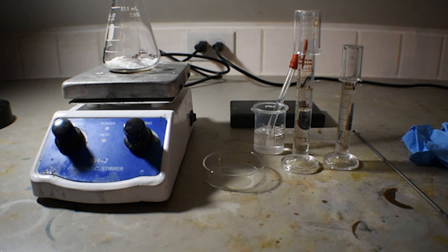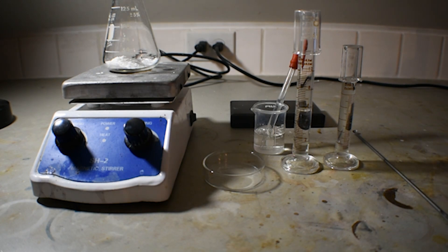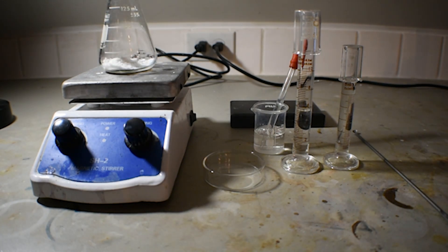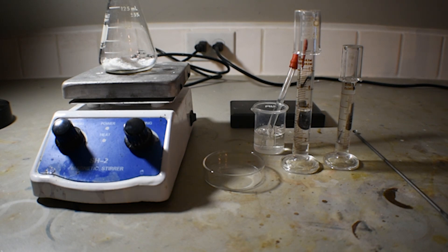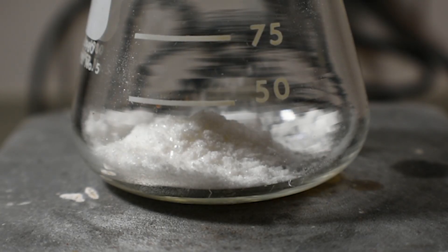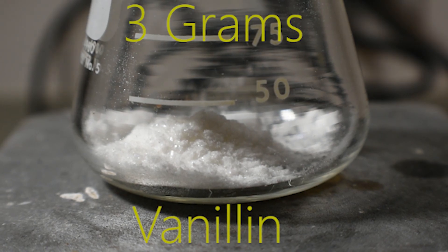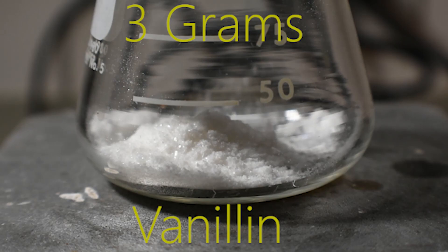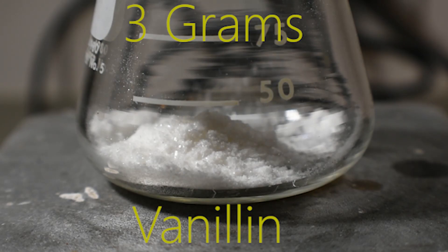First, let me get on my gloves. Now that my gloves are on, let's go over what we're going to need for this reaction. The primary reactant is going to be vanillin, of course, and I have 3 grams of it in this 125 milliliter Erlenmeyer flask.